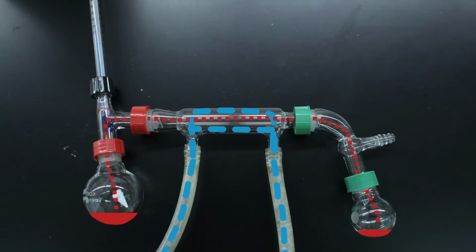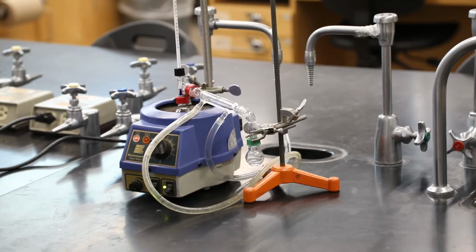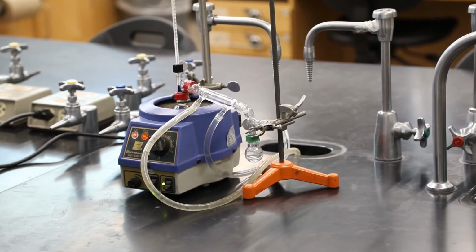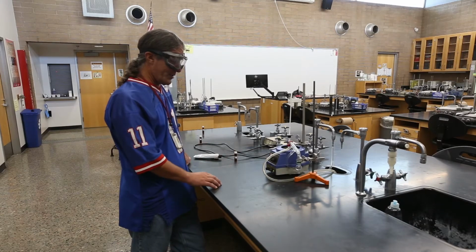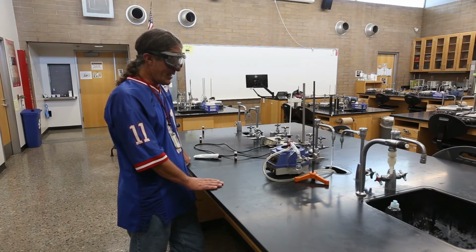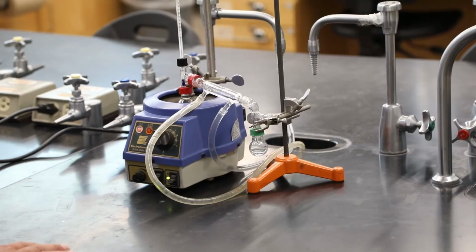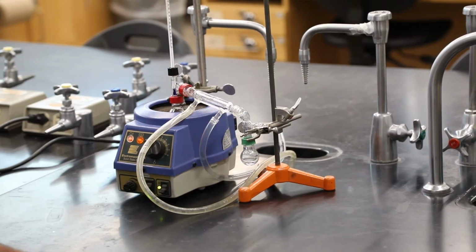This would be super exciting if this was a new compound that we're going to do research with, or something we were making for a drug company that would sell for $1,000 a drop. We'd be looking and going, whoa, each drop, another 1,000, another 1,000. Since this is hexane, it's still just mesmerizing watching this stuff boil, condense, and drip.